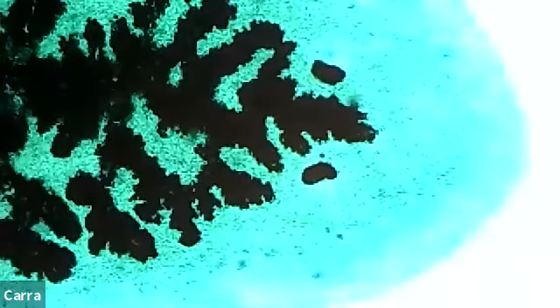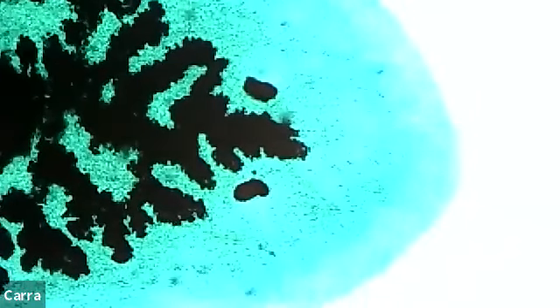And we're going to take a look at a microscope slide of a flatworm, and this flatworm is called a planarian. So in this planarian, we can see, let's see if I can get the contrast a little bit better. All right, there we go. So you can see the green outline, and it is kind of translucent. And that's because it's a flatworm. So it really is just absolutely so flat.